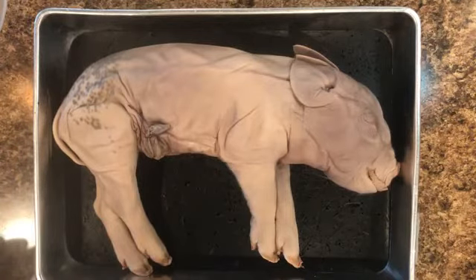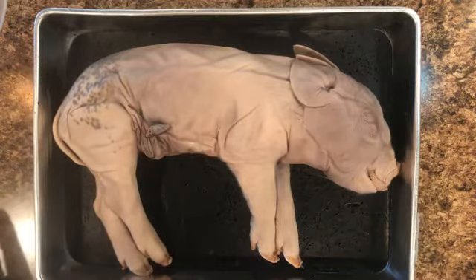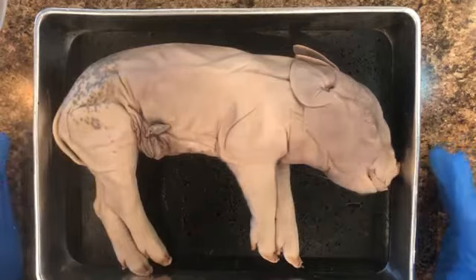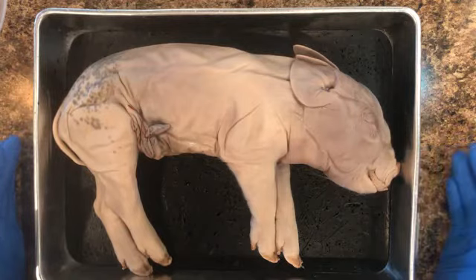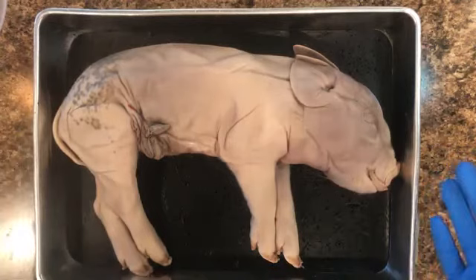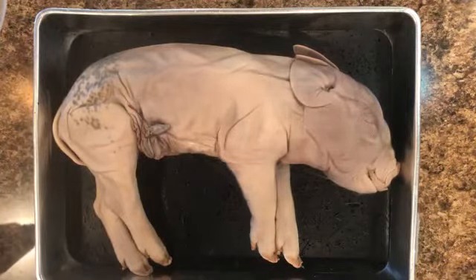So why are we looking at pigs? Well, first off, pigs look internally almost identical to a human. They're readily available, but not specifically bred or captured for dissection purposes. So this poor little fetal pig, even though some of you are saying, oh, it's so cute, this is so sad, yes, I understand that. However, this fetal pig was going to be a byproduct of the meat industry, and if it wasn't used for educational purposes, it would have gone on to become fertilizer or been disposed of in some other way.